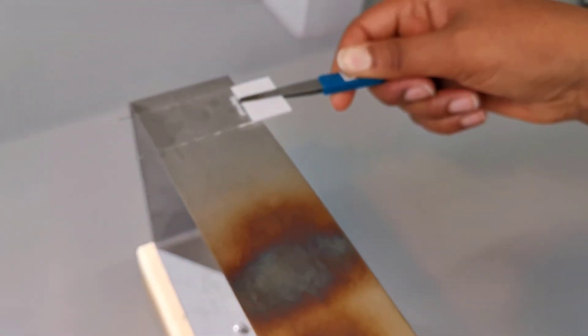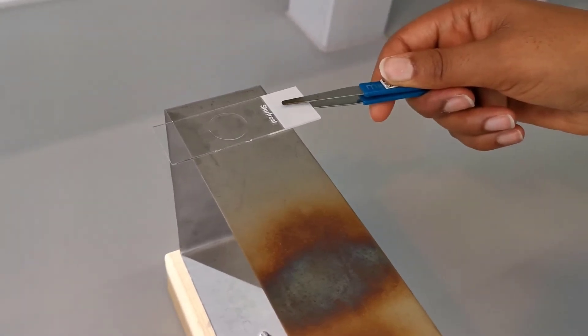And here again, care must be taken not to overheat the slide as excess heating will destroy your specimen.